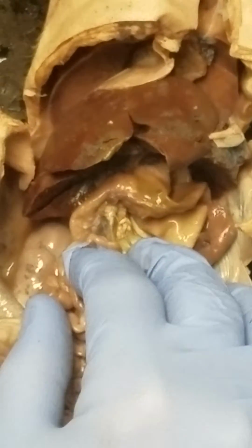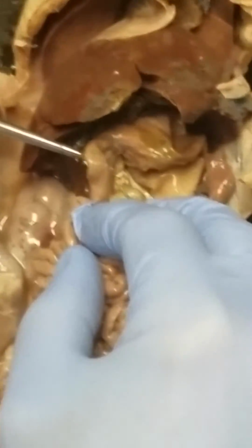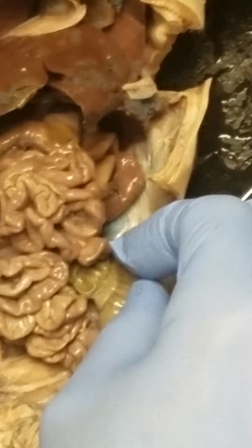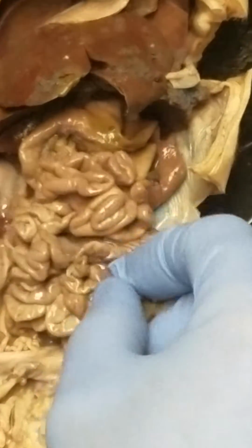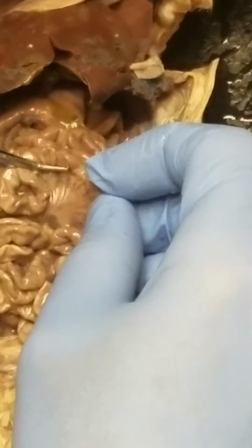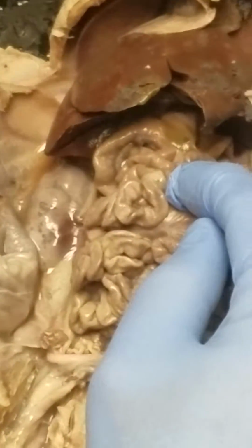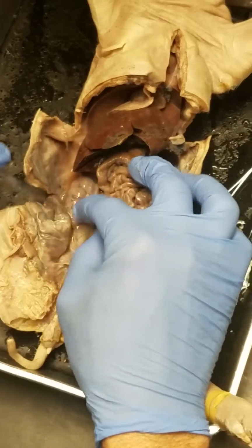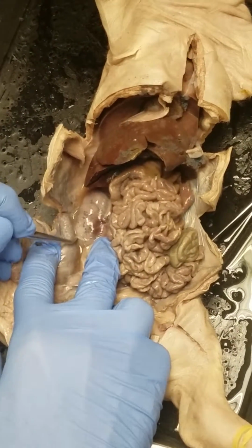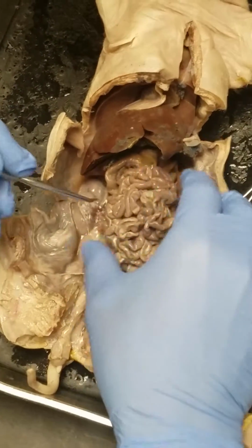I'll always say words like, name the valve. Duodenum, so you have to know the duodenum as itself. As soon as you get to here, you can call it small intestine. The small intestines, if you look around, you'll see these little shiny membranes. Those are mesenteries. If you want to see more serous membrane products, you can see them over here. This is parietal peritoneum. I'm peeling the parietal peritoneum back. I'll just peel a little bit back.